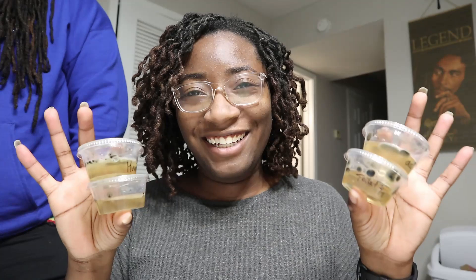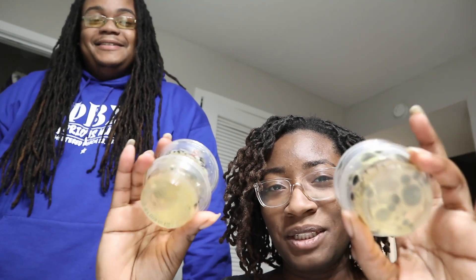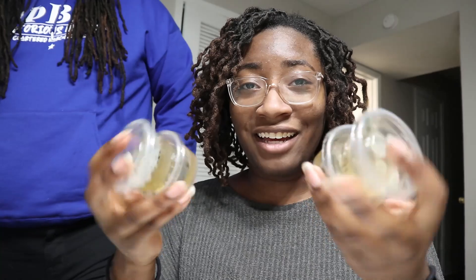That's it for our day eight check-in. I am about to dispose of these and get them out of this apartment. That was pretty fun — it was interesting to watch. We need to get up out of this apartment with all this mold. It's a lot of mold, and I was trying to tell them it's just common household mold, but it is a lot for the confined area that we live in.